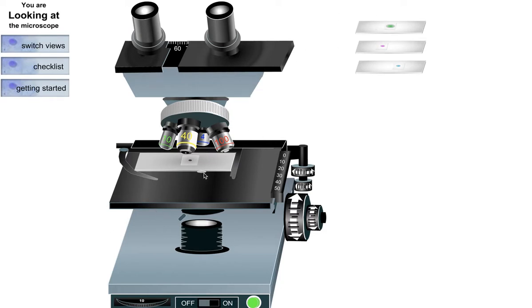And so now you want to set up the microscope. So you want to make sure that the image is right over the light. So the light is coming up here. And you can make it really bright so you see where it is. And so this is the light coming through, and this is where the light is right here. So we're going to use these knobs here to go back and forth until this is centered here.